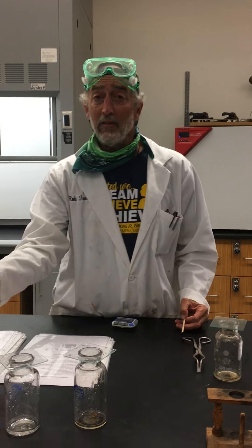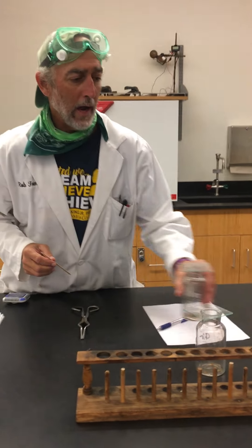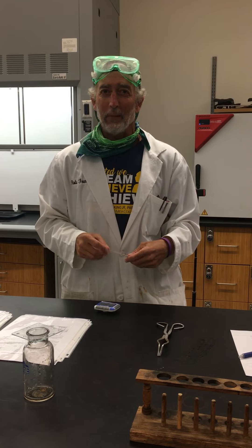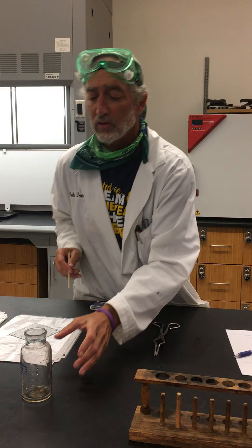At this point I've made five bottles of oxygen. We have one bottle of air here. So what we're going to do now — if you recall I've already said this before and I'm going to say it again several times — one of the most interesting properties of oxygen is it supports combustion.